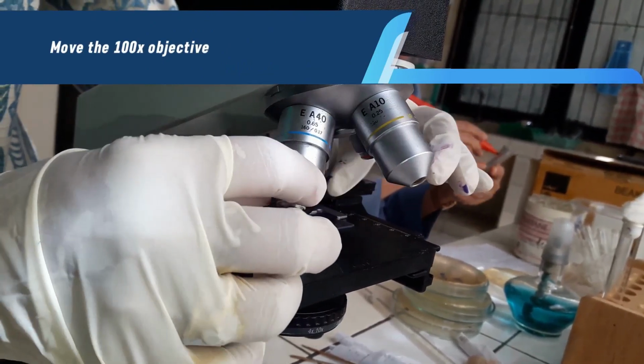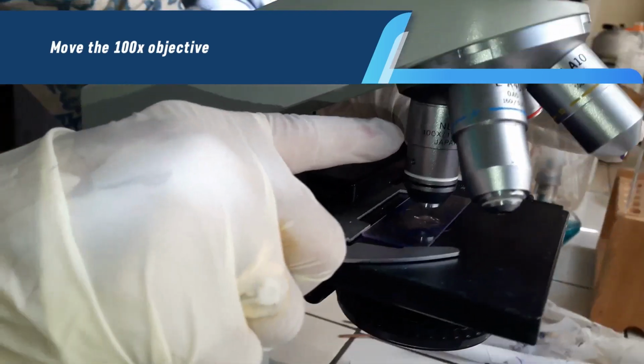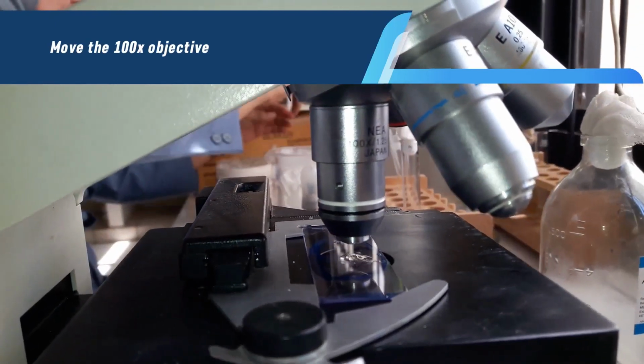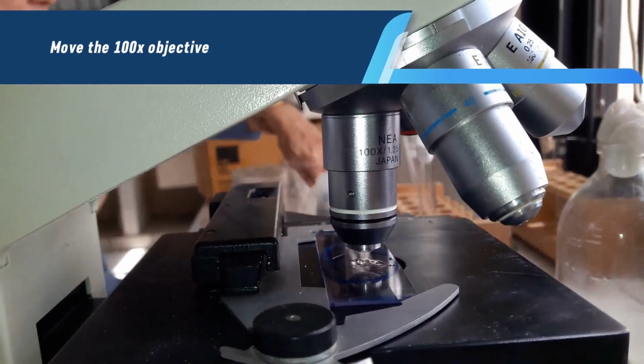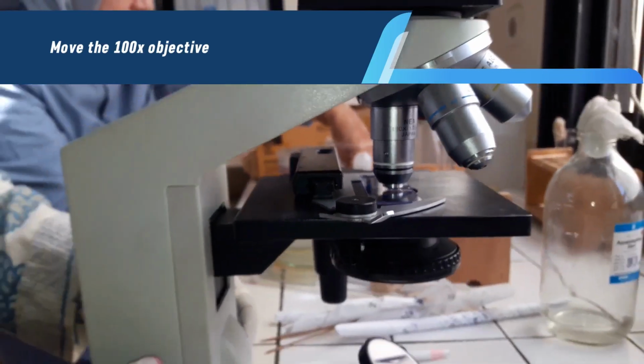Look through the microscope. You should see the stained material, but it will probably be out of focus. Look into the eyepiece and slowly rotate the coarse adjustment knob to bring your specimen to focus. See to it that the slide does not touch the lens.